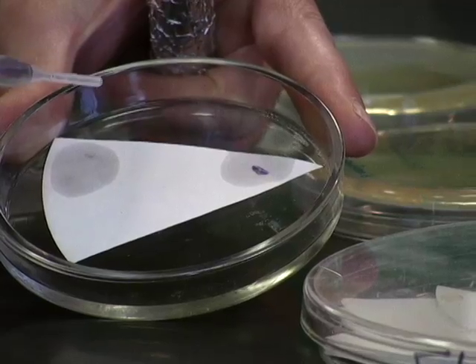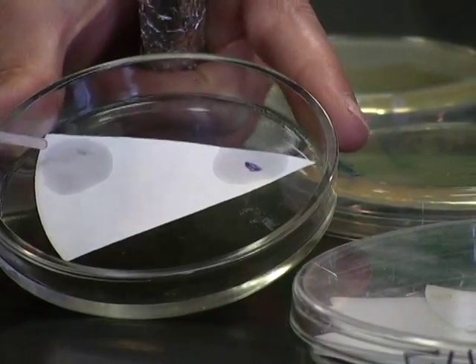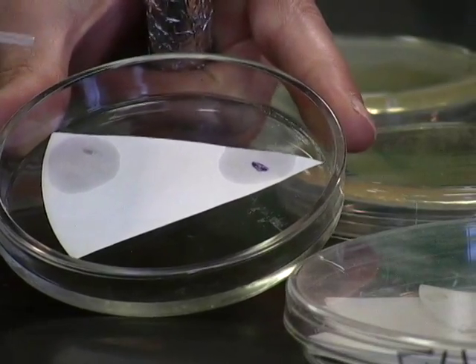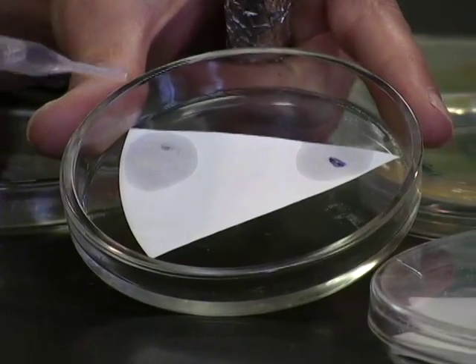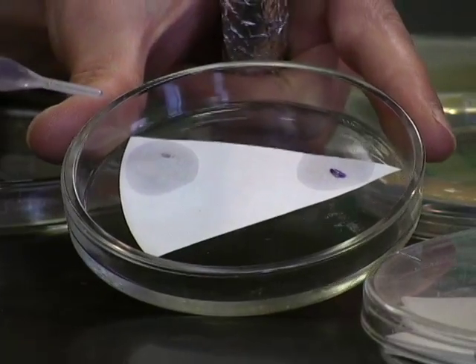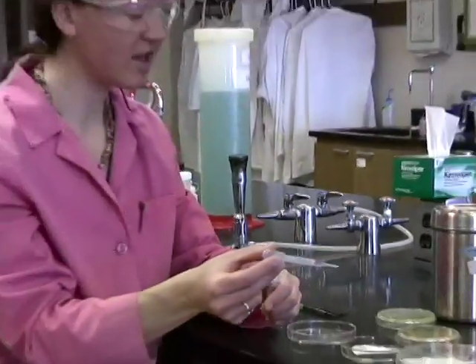But the longer I sit here and talk, you're going to watch the negative as it starts to turn purple due to natural oxidation. So time is of the essence. You have to read the results of this test within only a few seconds. If you sit around and let it turn, everything is going to look positive. So it's very important to have a positive and a negative control every time you do this, and to watch the results within only a few seconds after adding the reagent.